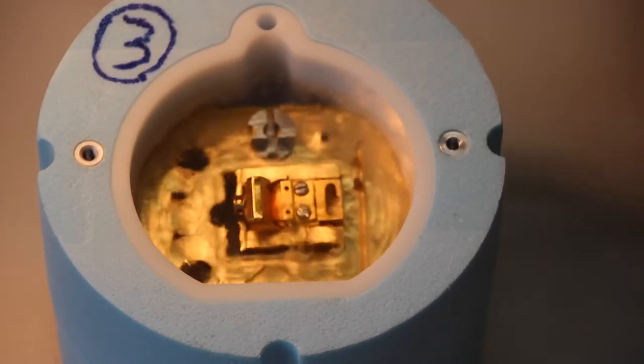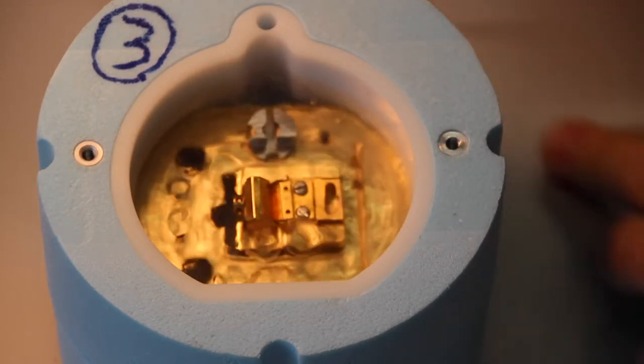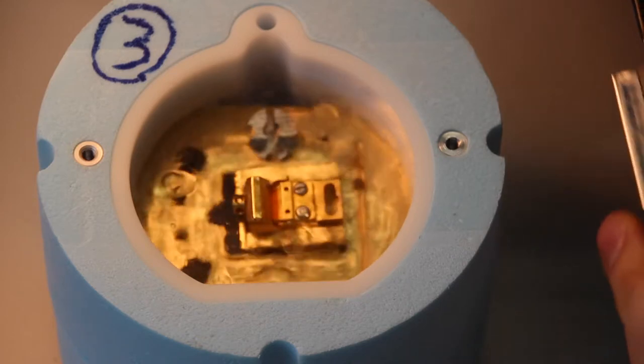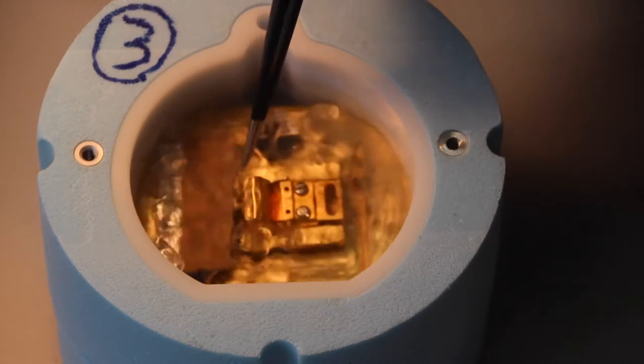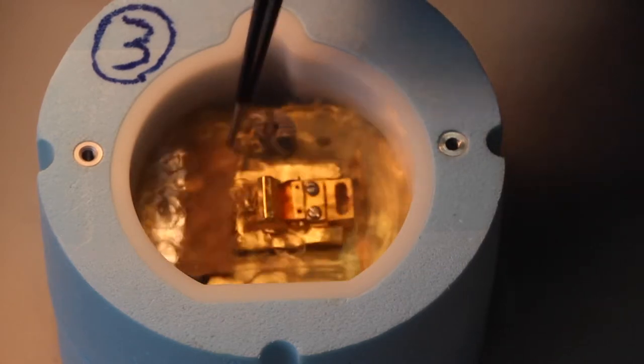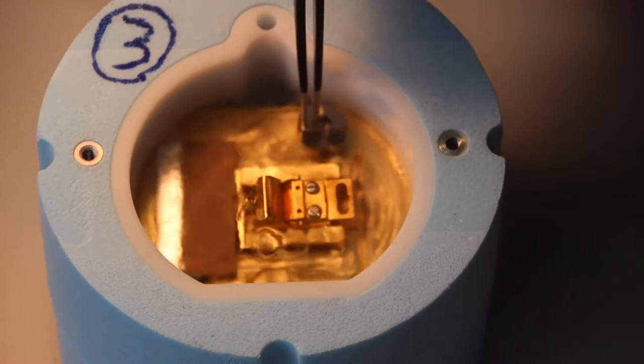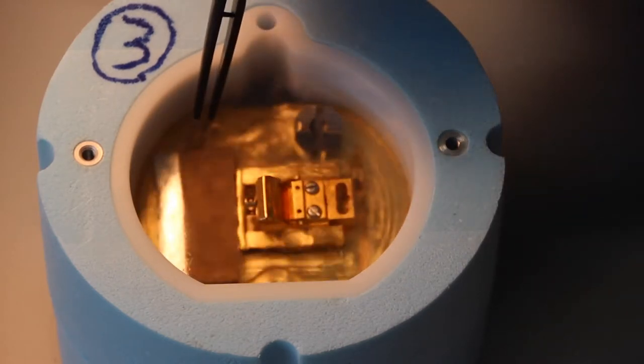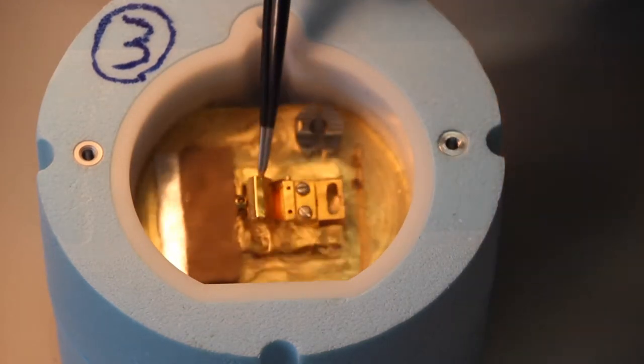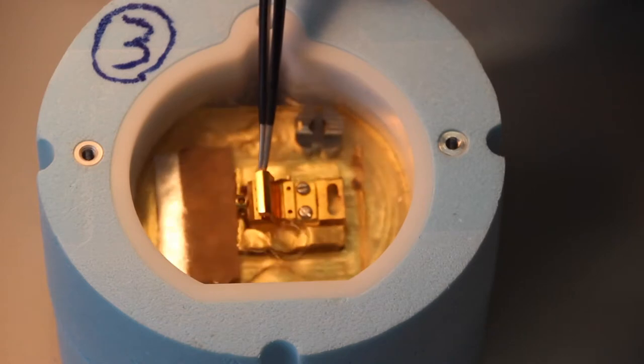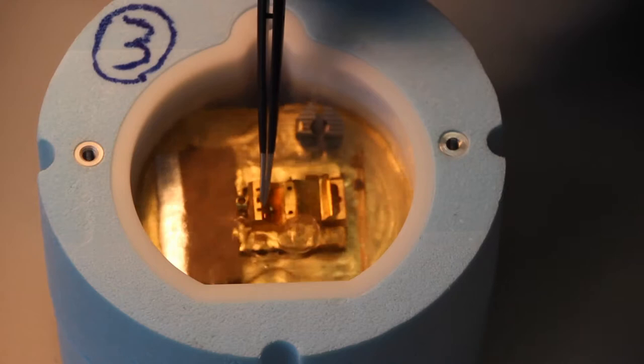Now we have our grids clipped and hanging out safely over there. Depending on your level of paranoia, and mine is high, you can cover up the holes in the stage that were useful for our clipping tool cooling with a covered razor blade and the clipping station over this hole here. I find that redirects the bubbles and you have less chance of losing your grid. We're going to open the shield for the shuttle here, which reveals the two areas where our clipped grids will go.